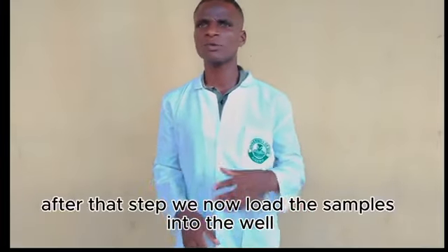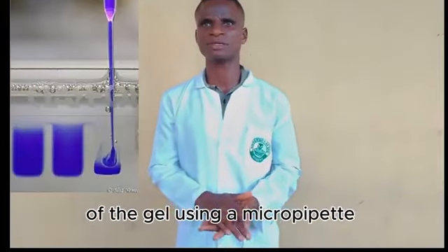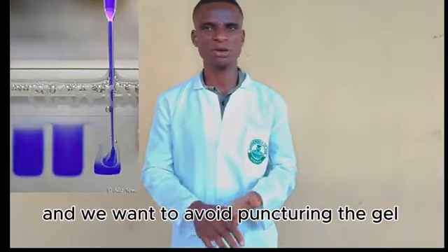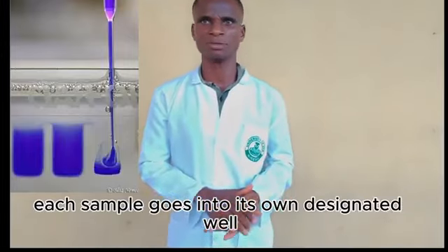After that step, we now load the samples into the wells. We take our prepared samples and carefully load them into the wells of the gel using a micropipette. These steps require a steady hand because the wells are small and we want to avoid puncturing the gel or cross-contaminating the wells. Each sample goes into its own designated well.